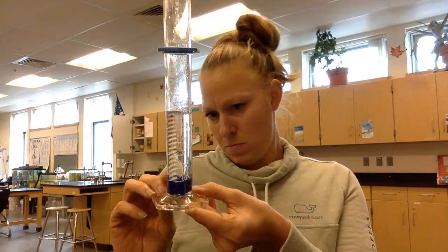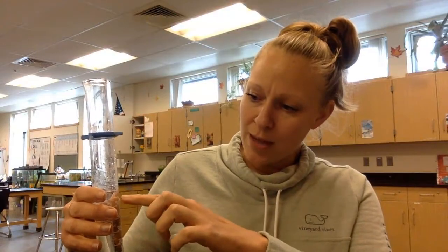Here I took 50 mils of water again, but this time instead of peas I'm putting beads to set up our control. I put enough beads — I think it was 38 — to maintain a constant volume. We're keeping the volume constant, so we have the same volume of beads as we do peas, and I'm going to put that in respirometer three.